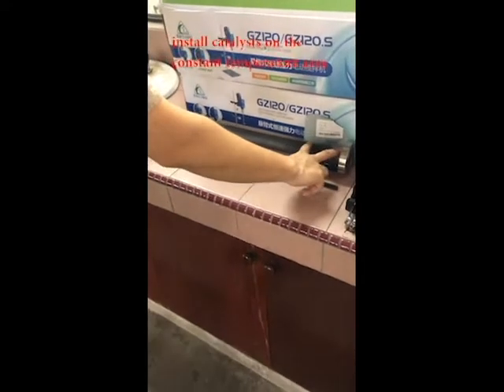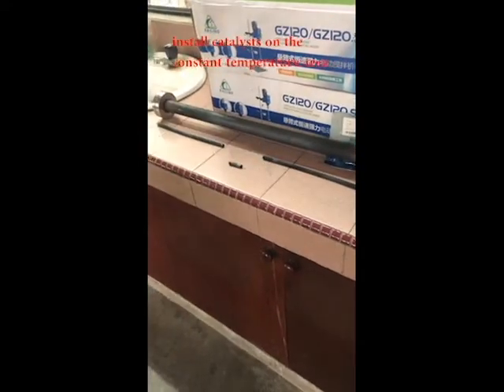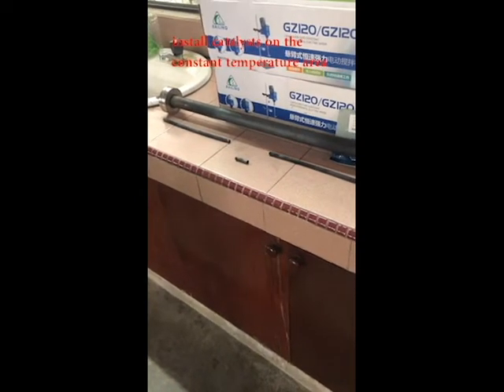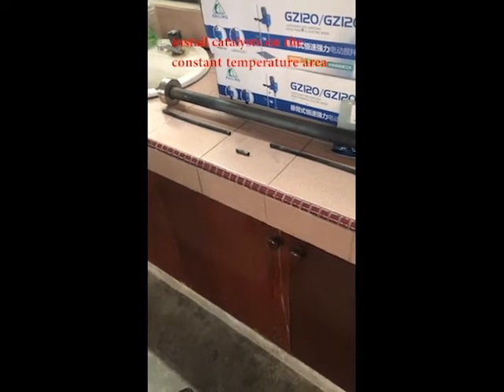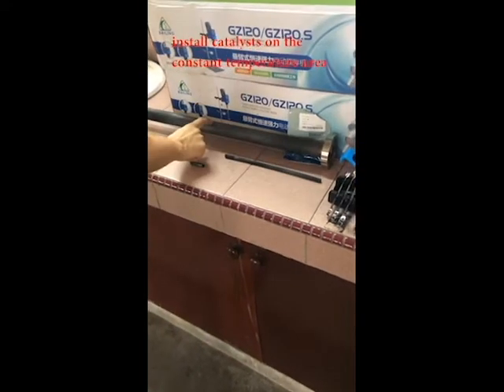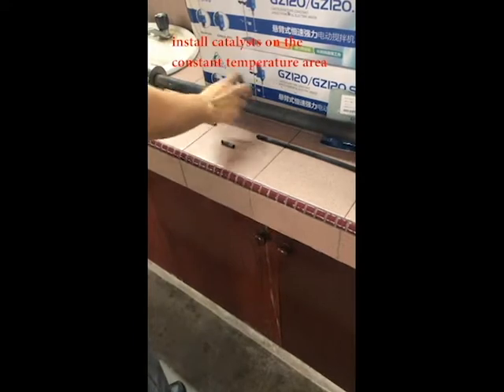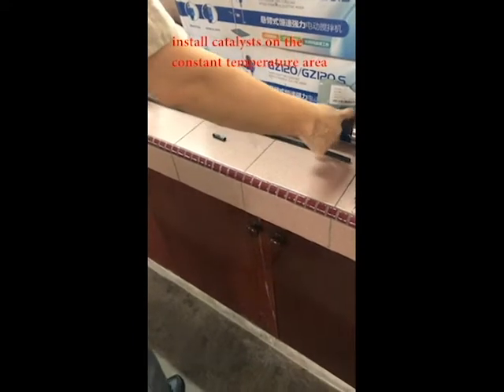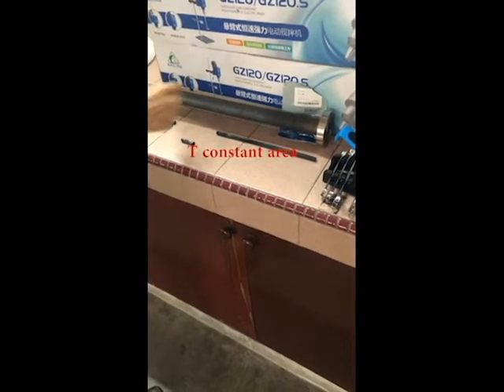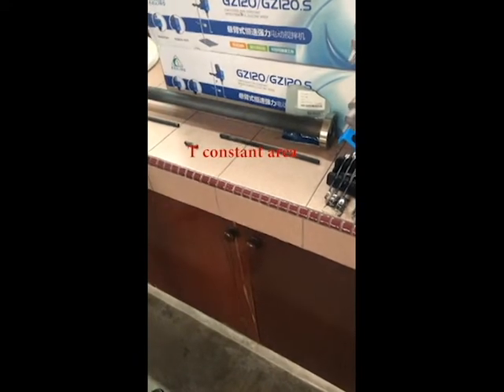Temperature difference between both ends and the middle, maybe go 50, based on our previous testing. Because in here, we have 3 different thermocouples inserted here, here, and here. But with the length of this 60 cm reactor, we have a constant temperature in the middle. Yes, this one is based on our calibration.